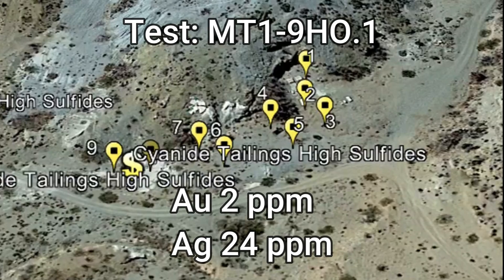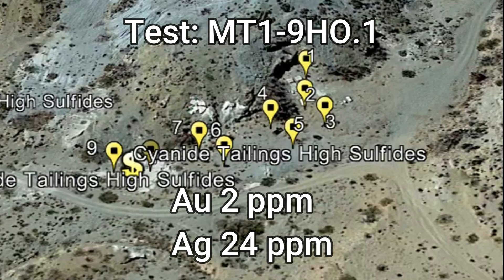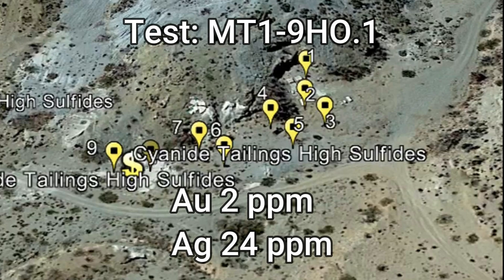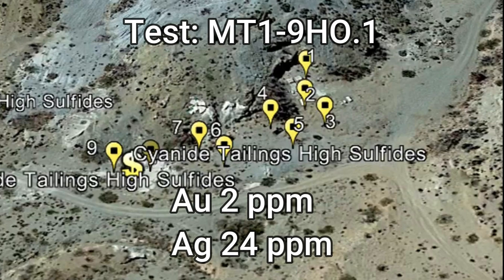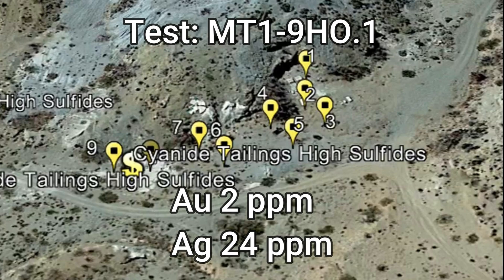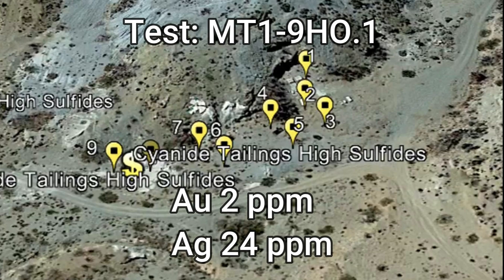First up is MT1-9HO.1. M is for mill site, T is for tailings, one through nine are the samples we took, HO stands for head ore, and .1 is our first assay in this area. The results came back at two parts per million gold and 24 parts per million silver, which converts to two grams of gold and 24 grams of silver.